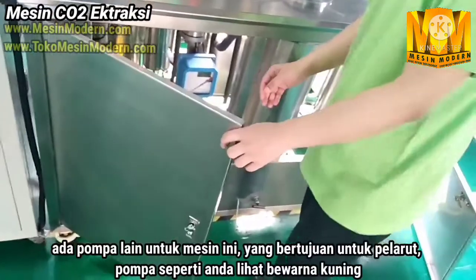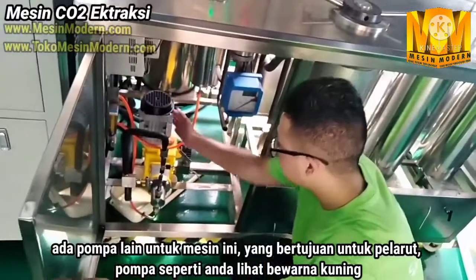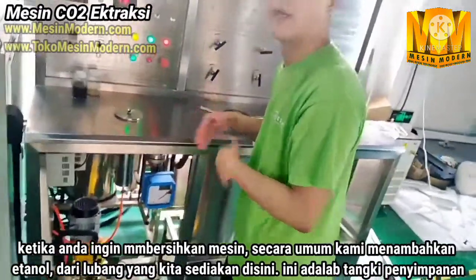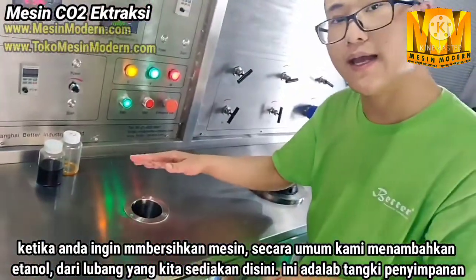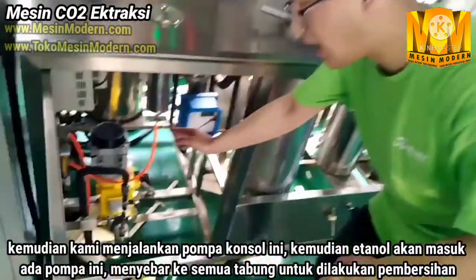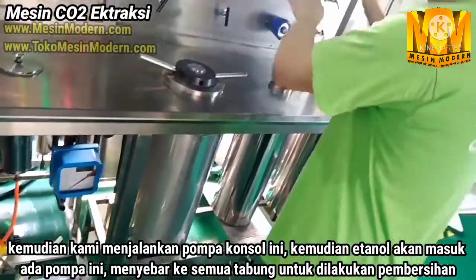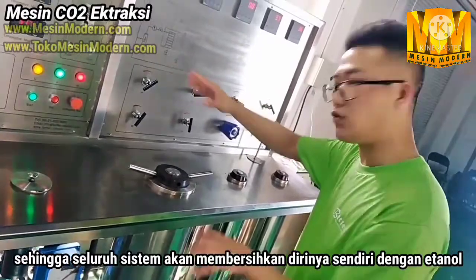There is another pump for the machine — it's called the solvent pump. It's this yellow pump here. When you want to clean the machine, generally we will add some ethanol from here — this is called the solvent storage tank. We add ethanol here, then we run the solvent pump. The pump will push the ethanol into the extractor, and it will run through the whole system, so the machine will be cleaned.